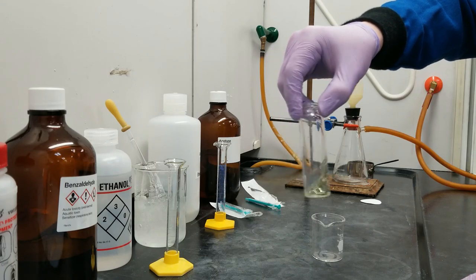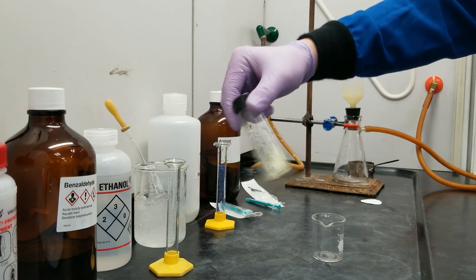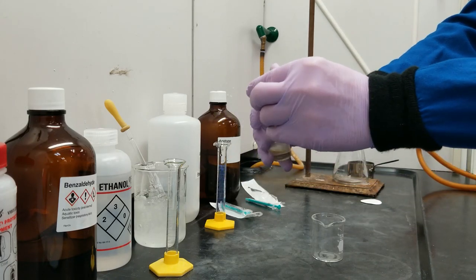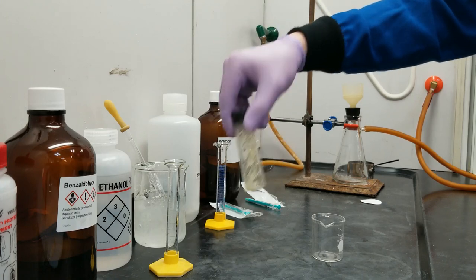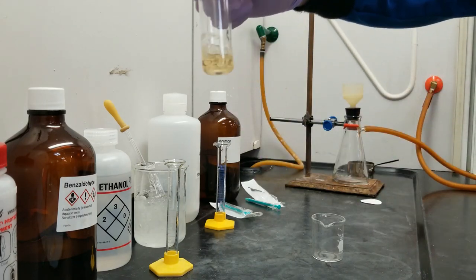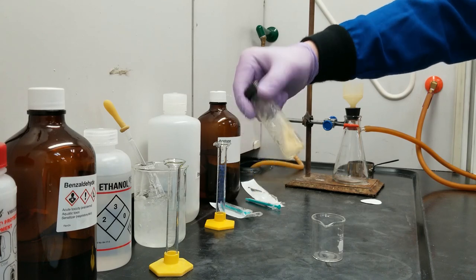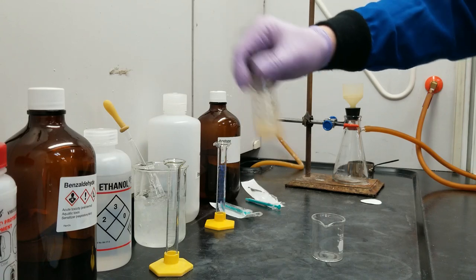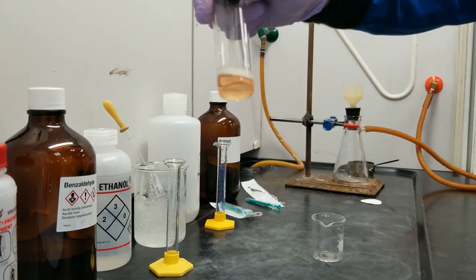Now I'm going to go ahead and get the cap on. I'm going to shake like this, and about every minute or so I'm going to vent it. It's going to stay nice and boring because we're venting so often that pressure is not allowed to build up. And you can see that yellow color starts to develop — it's turning more of a peach color now.